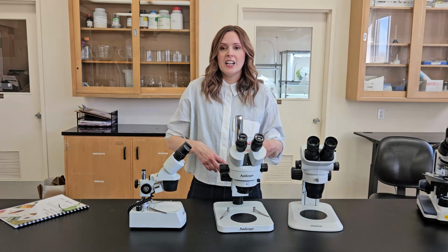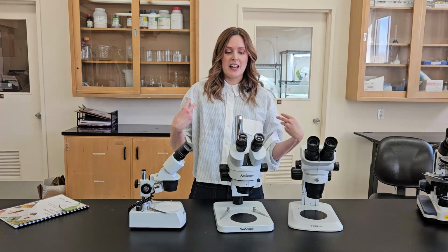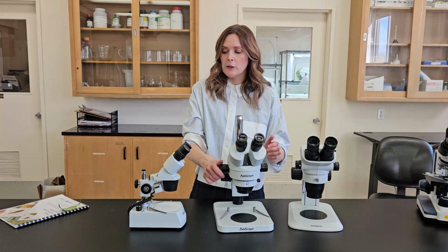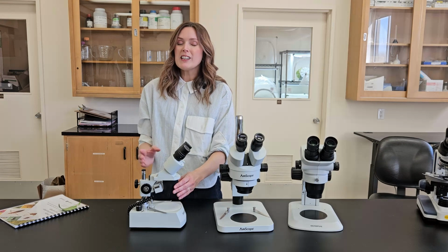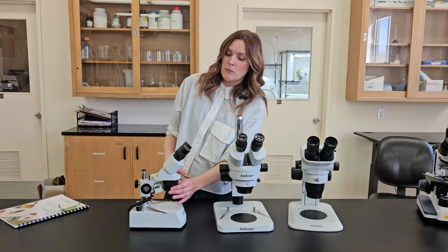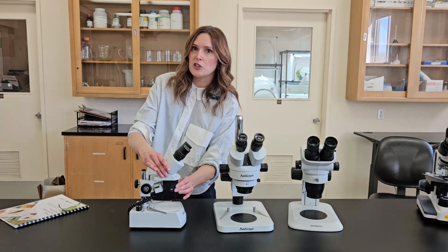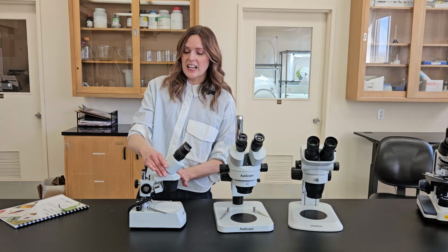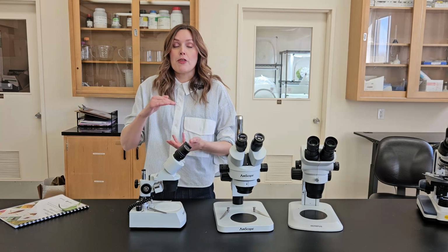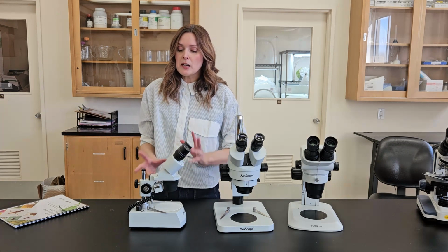If you're looking at something big, like a ladybug, you're going to want to be closer to that 7. And then if you're looking at a thrips, you're going to want to be all the way to the 45. Something like this microscope, though, really only has 2 magnification settings on it. So it's got a 20 times magnification and a 40 times, and they just snap into place. So you're not able to get that range between the 20 and the 40. So 30 might be your perfect magnification range for whatever you're looking at. So that can be kind of frustrating.